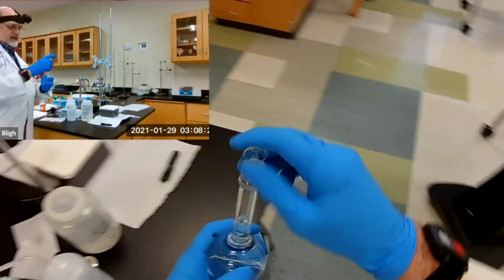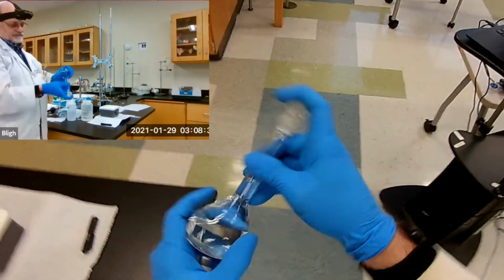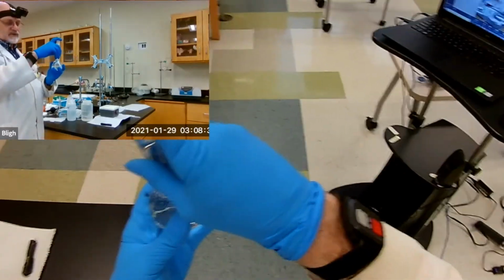Now, hold that cap in there tight. This stopper. And be sure it's well mixed.